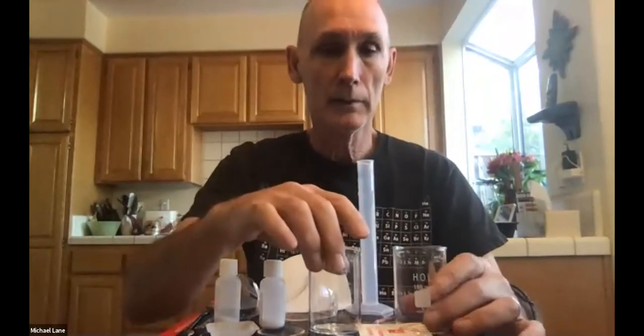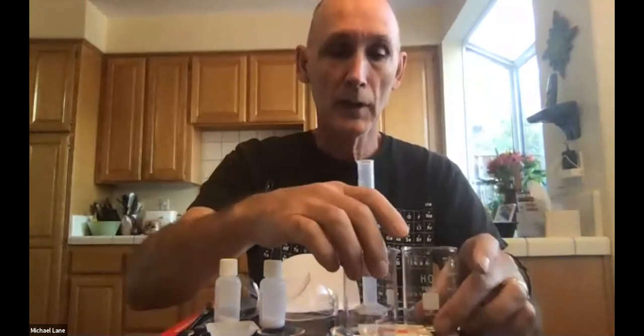So I'm back over here. And again, we've got a couple of beakers. We have a weighing boat for the material we need. We've got calcium chloride, sodium carbonate that you came with, a spatula to move it out with. Of course, safety glasses, I'll put those on now.